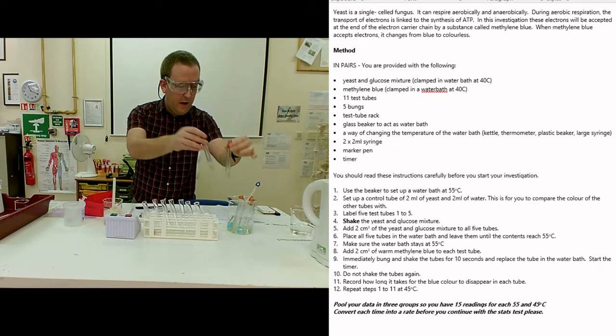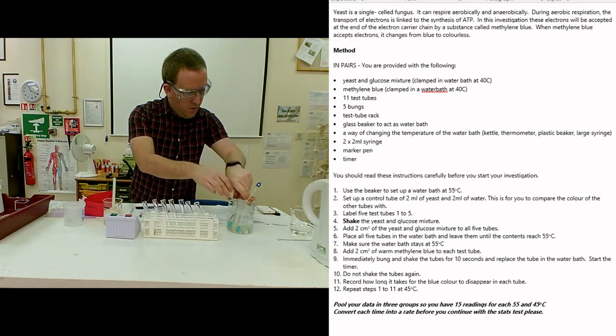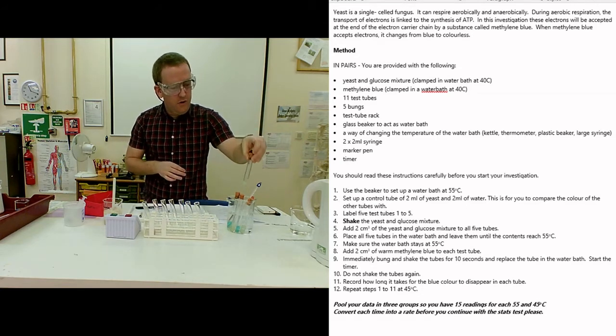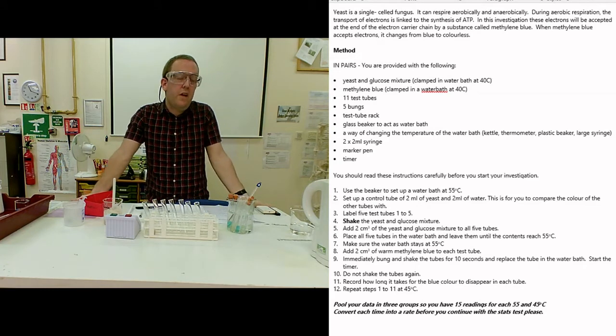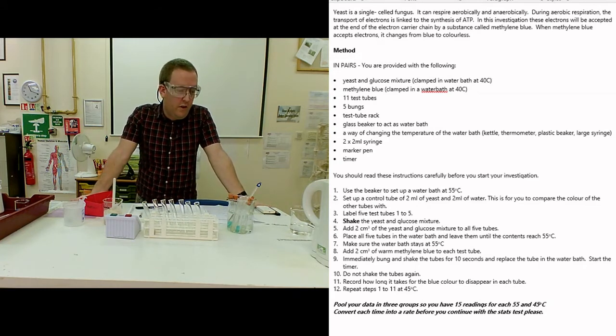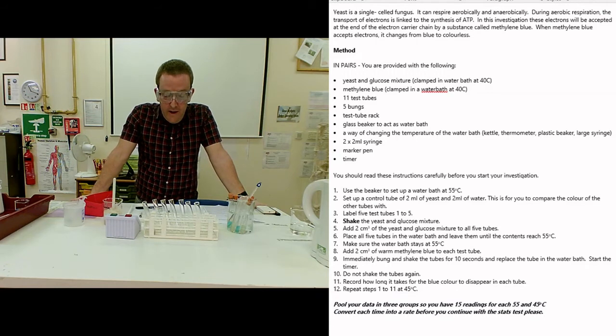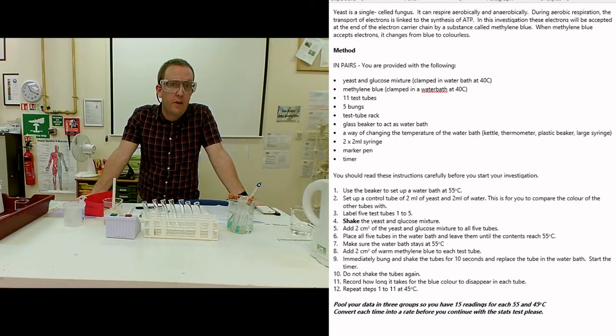These ones are losing color but they're not quite there. Have a look at the table of data provided and in the subsequent video for the kinds of times that you can expect for this experiment. I hope that's all clear as to how I've done that and why I've done it in that way. Thanks very much.